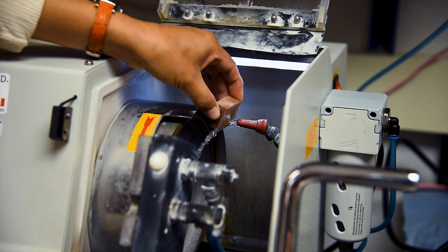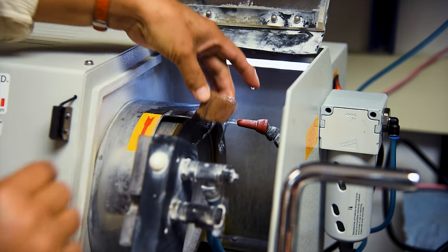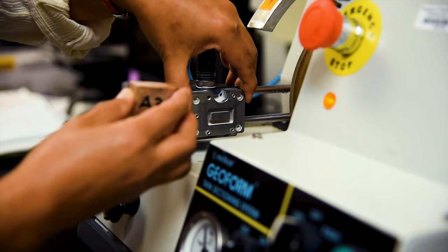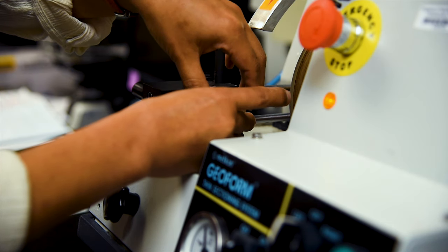If the slide is clean, it helps to get the surface of the slide wet before taking it to the vacuum chuck, as this will help create a better seal, same as we did when we frosted the slides. Next, position the slide on the vacuum chuck and, when ready, activate the vacuum pressure.